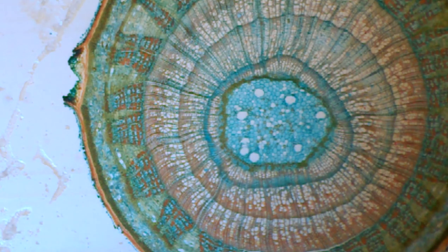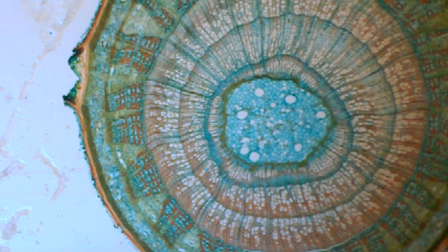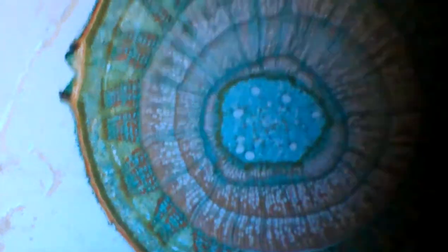Sure. So we've taken a picture of this already, and we have it on a computer screen in the other room with a scale so you can see how small everything you're looking at is. So, up and away we go.